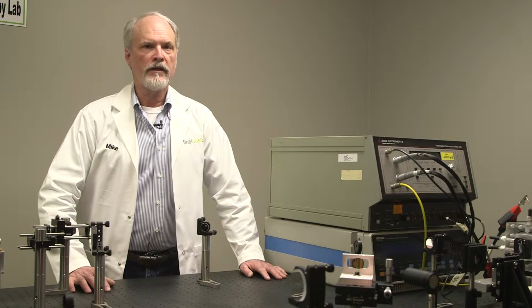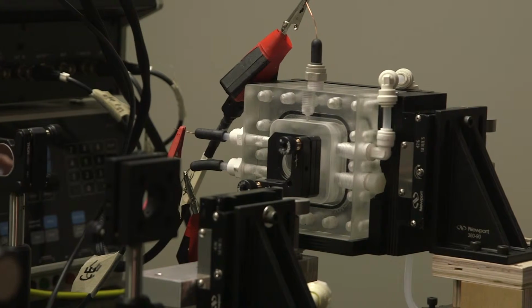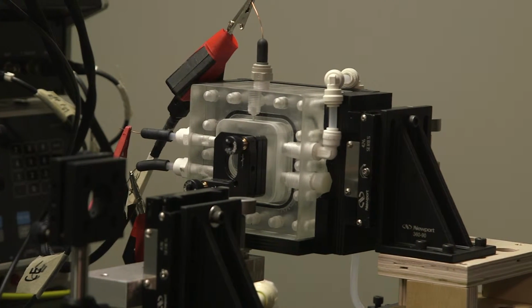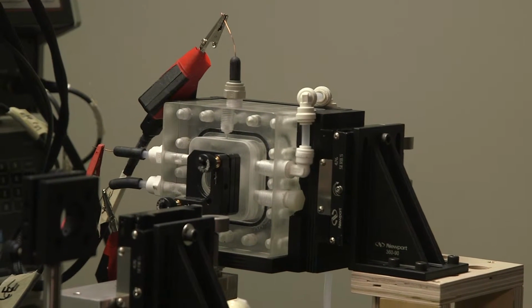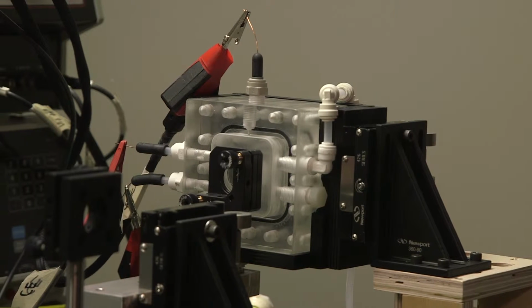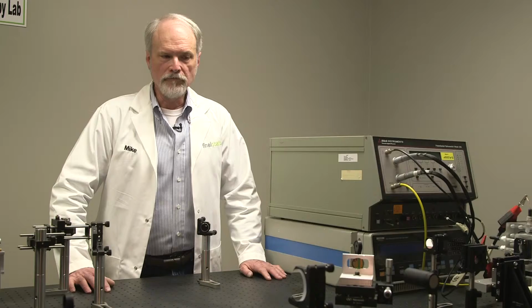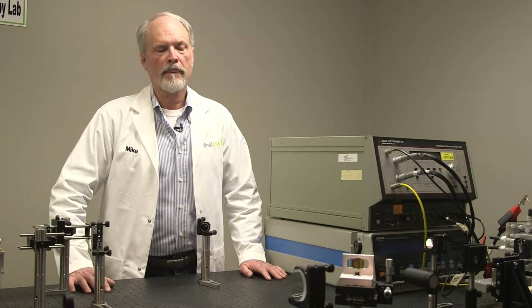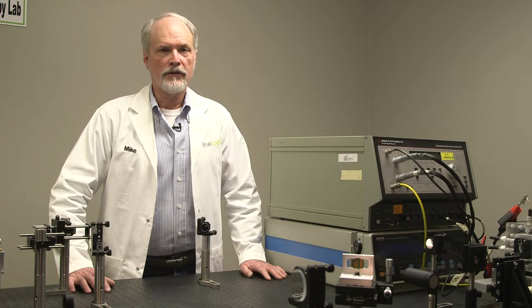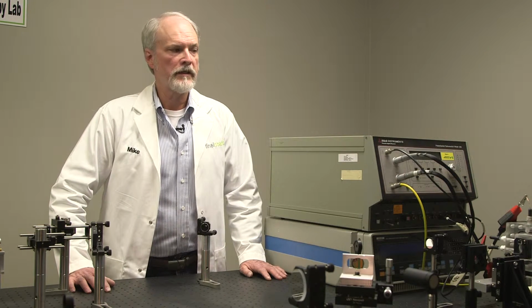That's rather unique. Almost all other analytic techniques that are used to study the surface chemistry of a corroding process require a hard vacuum, say scanning electron microscopy or EDS or X-ray diffraction. Obviously, when you take something that's been corroding underwater and you dry it out and put it in a vacuum, you've radically changed that surface.